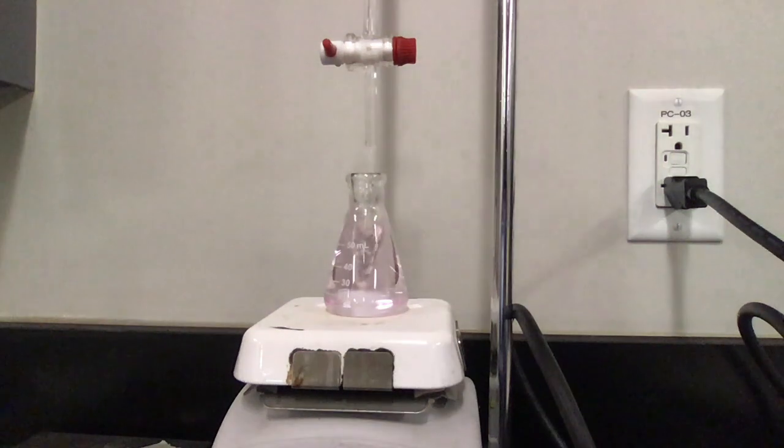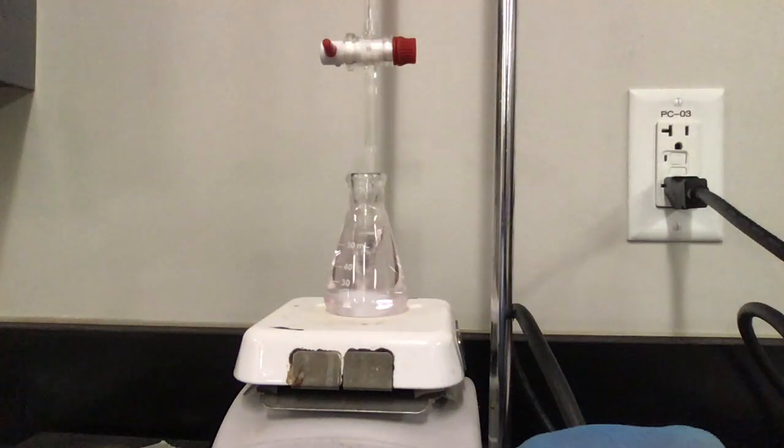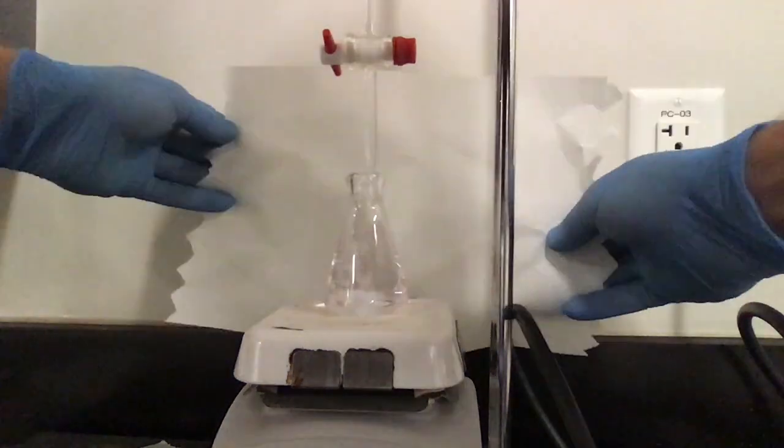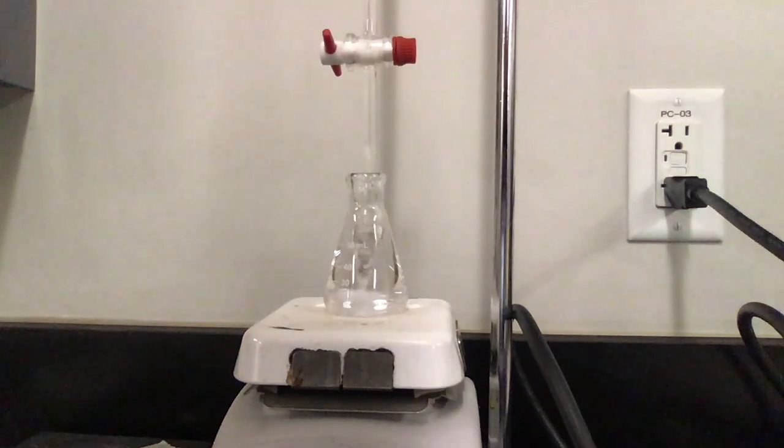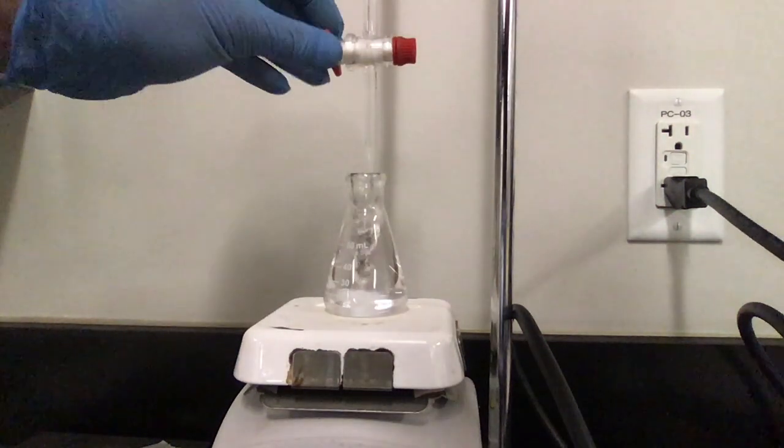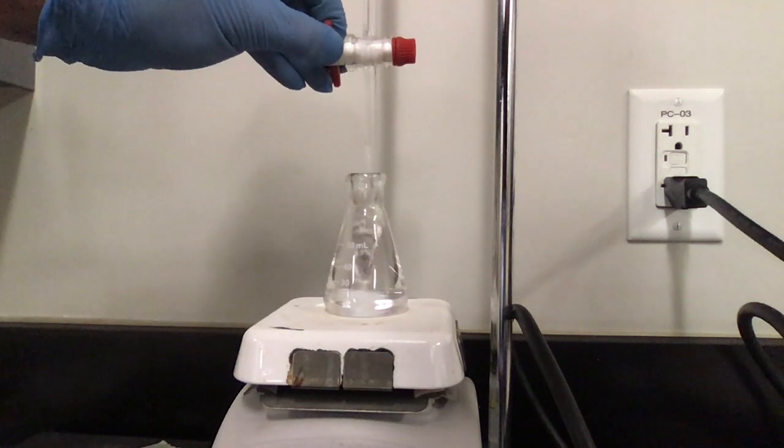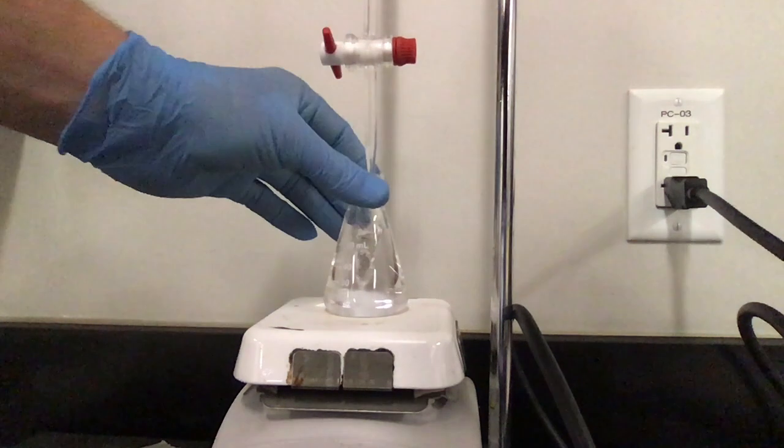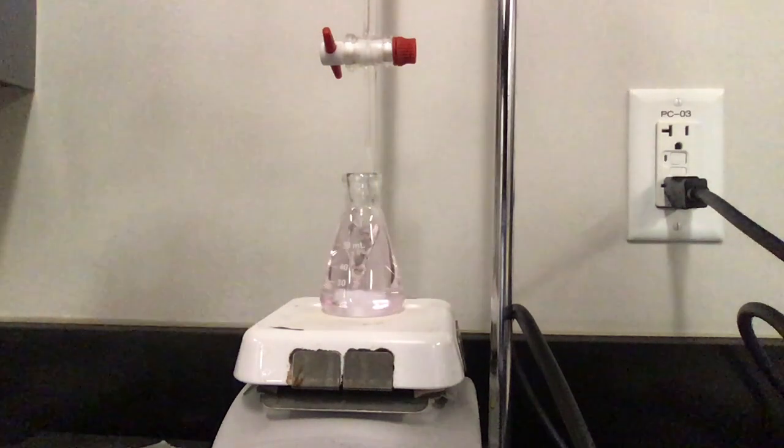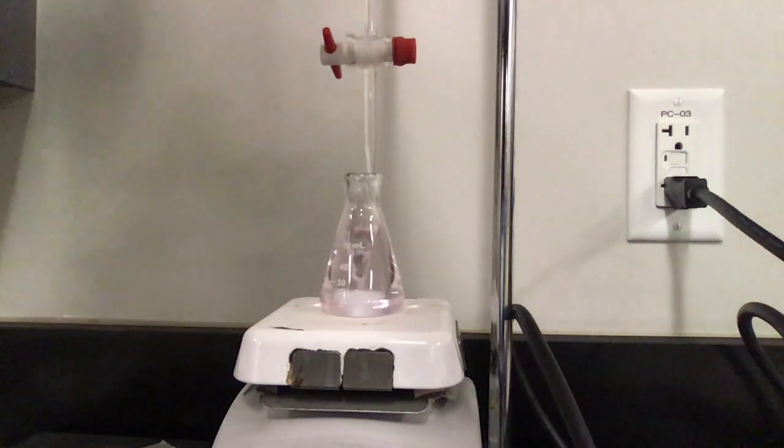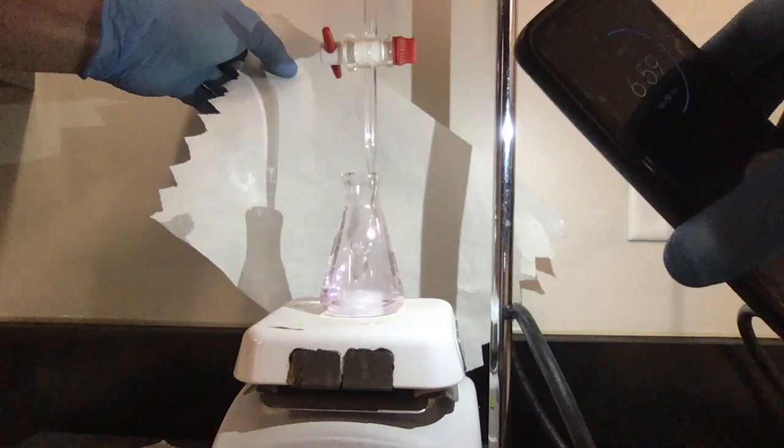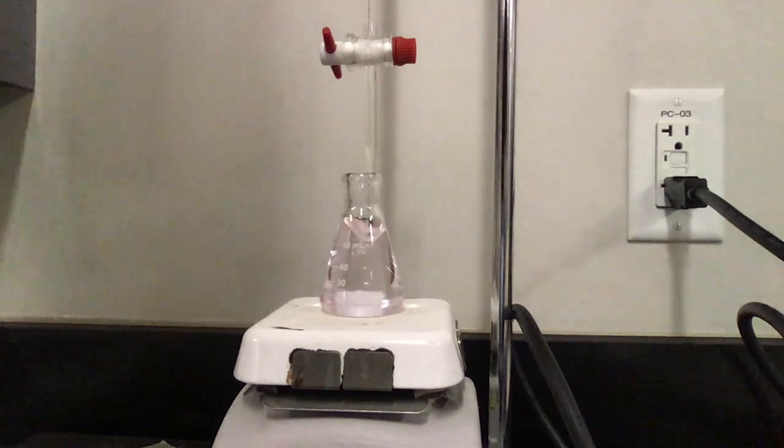All right. I stopped it. It's got a very slight hint of pink. We'll see if it fades. It looks like it's going to fade. Looks like I'm going to have to continue to add some more drop wise, but I'm really close now. Nope. Looks like one more drop and we'll do it. I was fooled. Pink. It's pink. Okay. So that's our first titration.